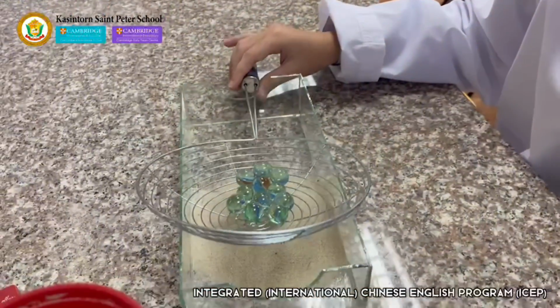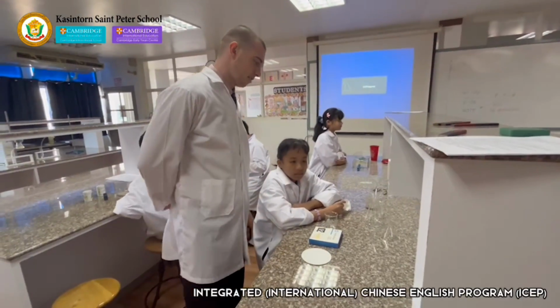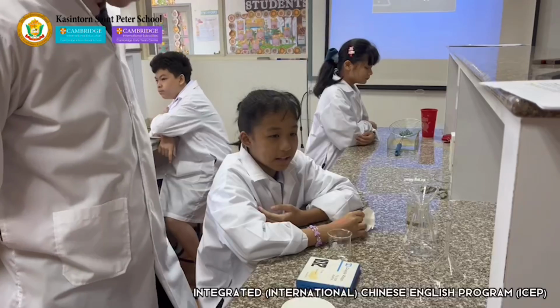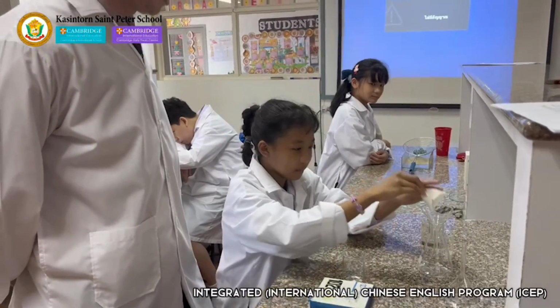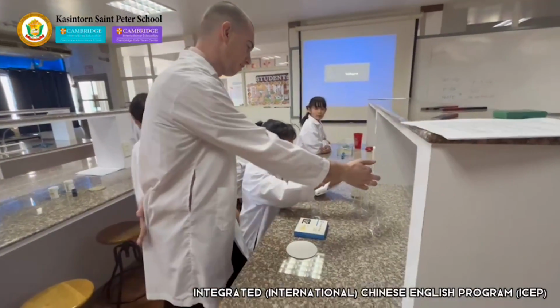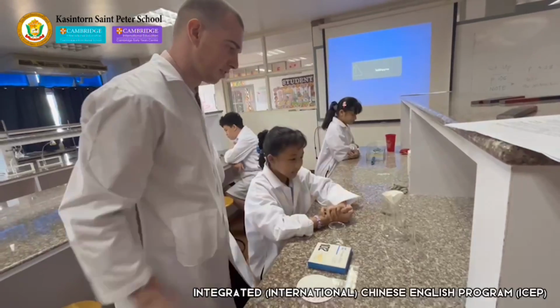Thank you. And for our third experiment, we have Ping Ping. What method of separation are you going to show us today? Next, we have a mixture of sand and water. We're going to use filtration to separate them. Very interesting. Show me how we will set up the filtration system. So we have filter paper that is folded up by Ping Ping and put in the funnel.